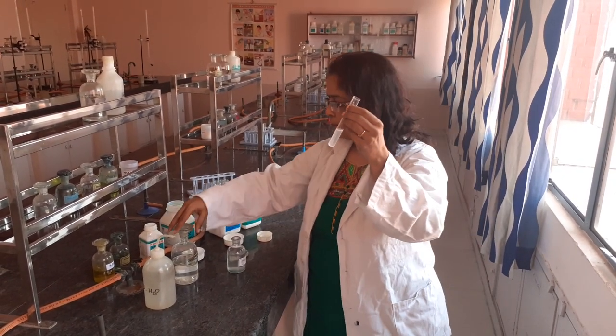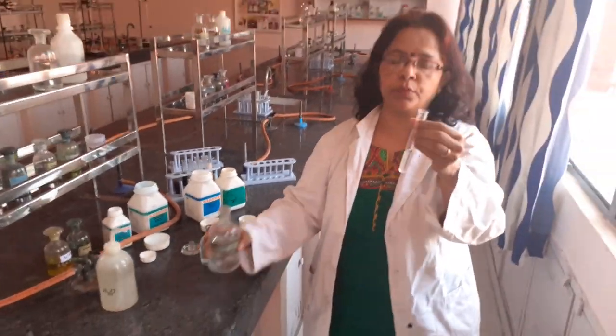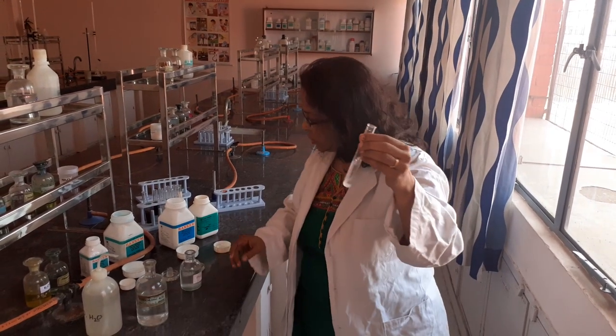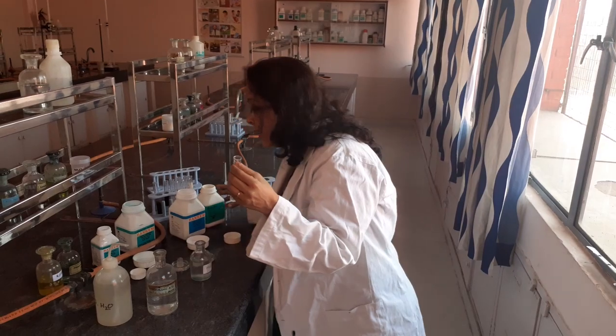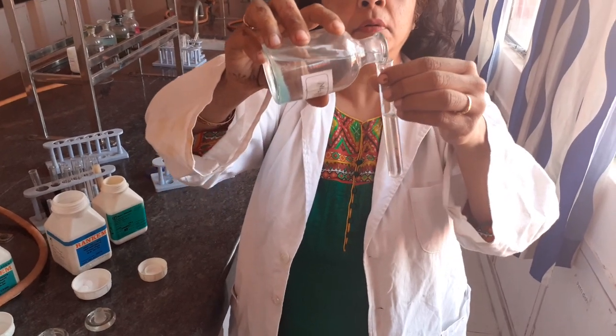In case you do not get it cleared, add a little amount of dilute HCl to clear it up. This step is only in case you are getting stuck with cation analysis — this is a shortcut to verify. To the OS, add HCl followed by the magic reagent, sodium sulfide. On adding sodium sulfide, you get a buff coloured precipitate — this fleshy, peach-ish or beige-ish coloured precipitate which confirms your Manganese.